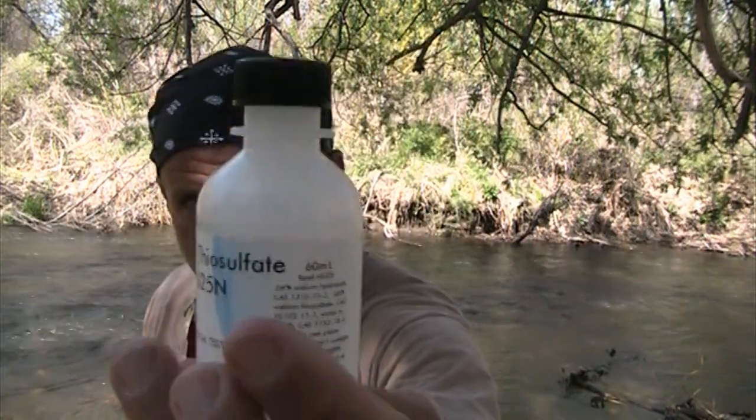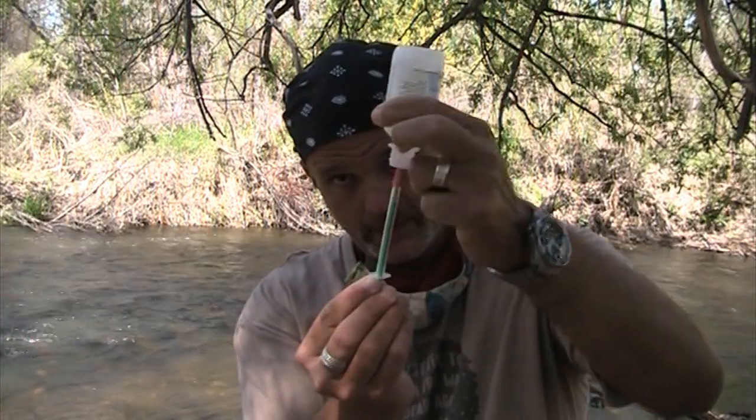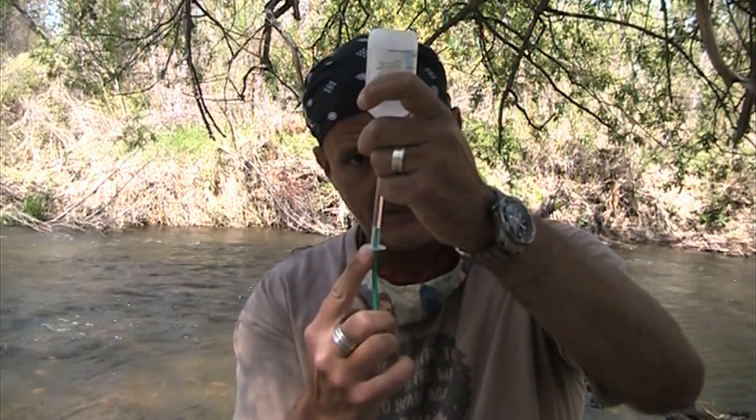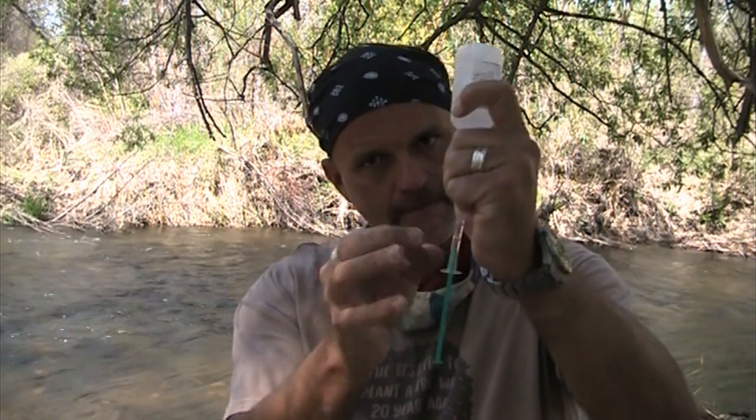My first goal is to fill that syringe with this sodium thiosulfate, so that there's no air bubbles all the way into this pink titrator tip. This is where you get to play creepy nurse. So what you do is you put it in, invert the bottle, pull it down farther than you need to, and then you're going to do the creepy nurse flick of science.